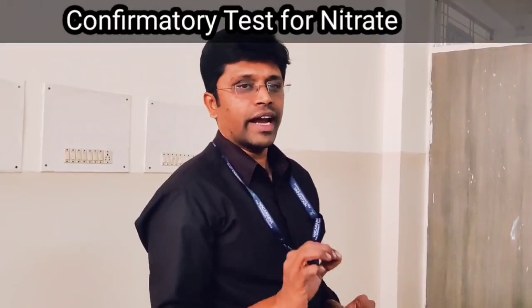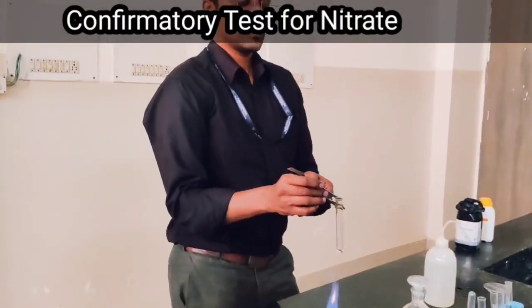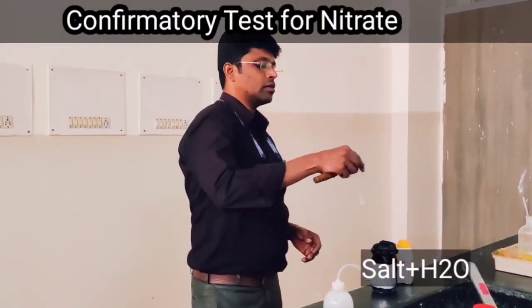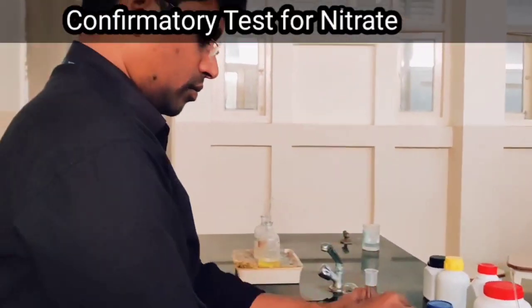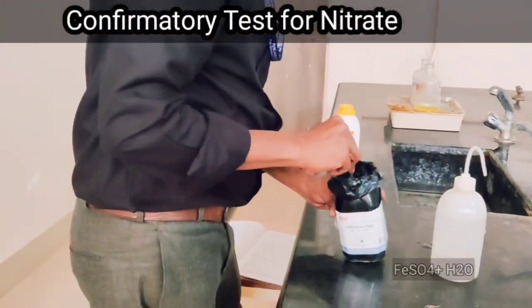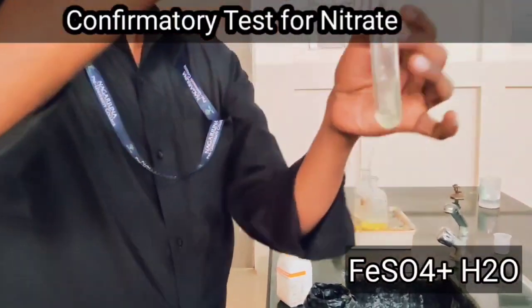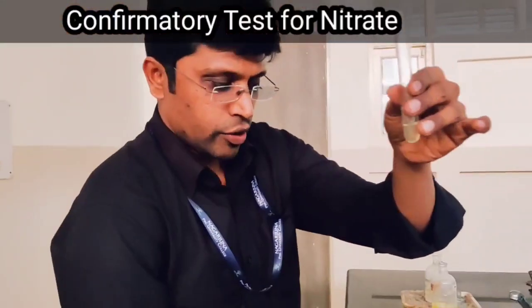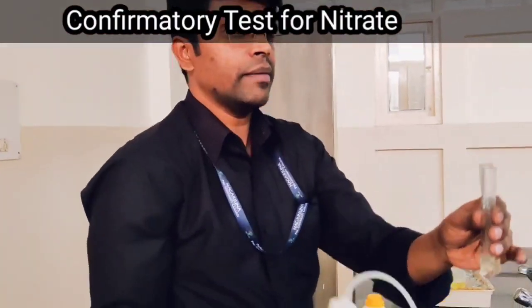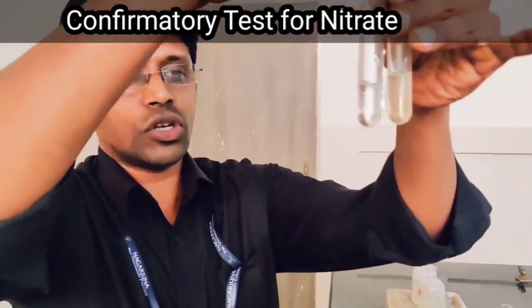The confirmatory test for nitrate is the brown ring test. For this test we have to prepare the salt solution as well as ferrous sulfate solution. We make the salt solution with salt plus water. The volume of the salt solution as well as the ferrous sulfate solution should be almost the same. Equal volumes of both solutions have to be taken.